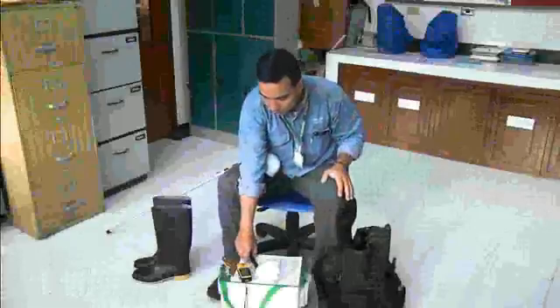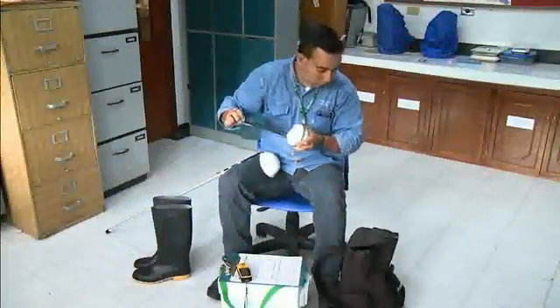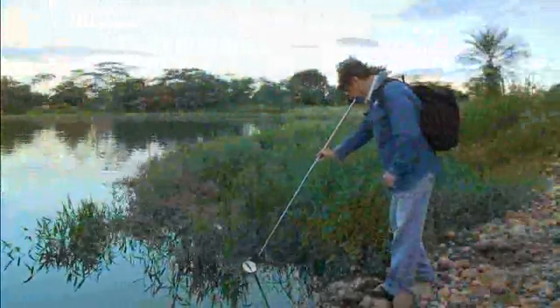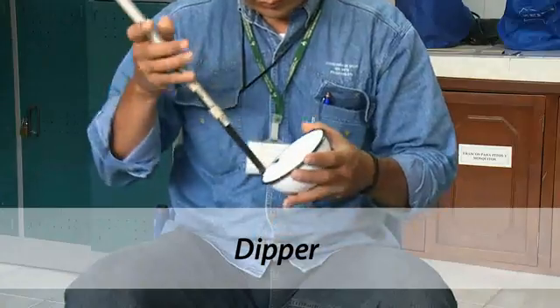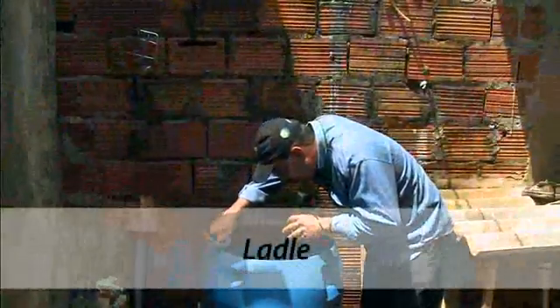The collection methods and devices used will depend upon the type and size of breeding places to be investigated. You will need an extendable dipper to collect larvae and pupae from hard-to-reach places, with a 400 milliliter capacity cup. Smaller ladles can be used for collecting larvae from very small breeding places and from tree holes.